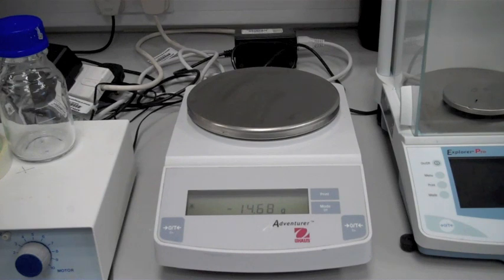Okay, I'm now going to show you how to weigh out enough LB media to make your LB Agar plates.